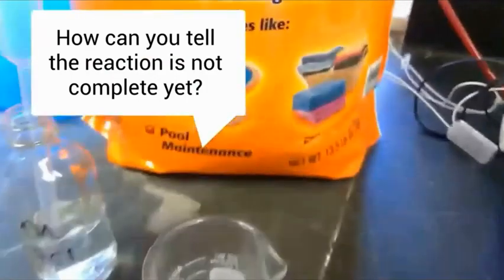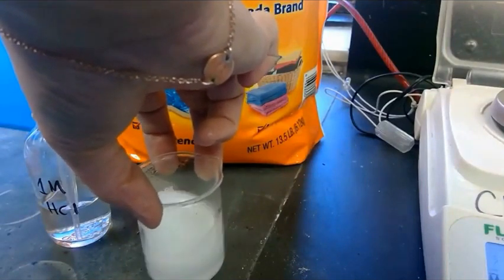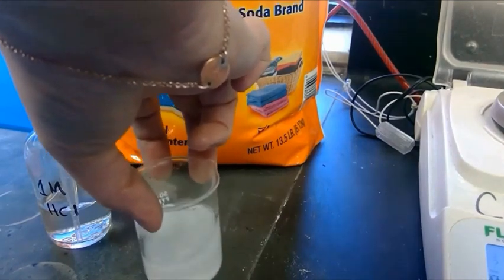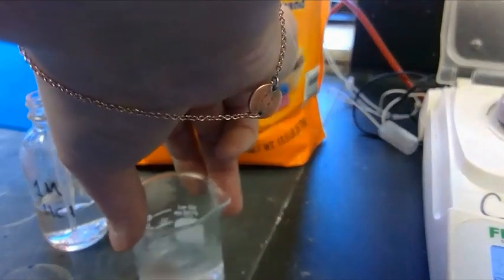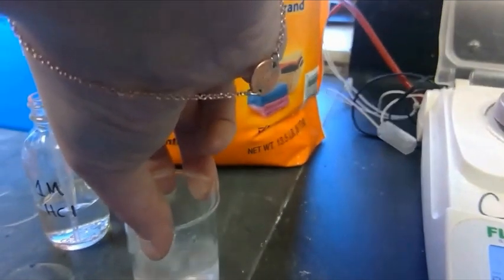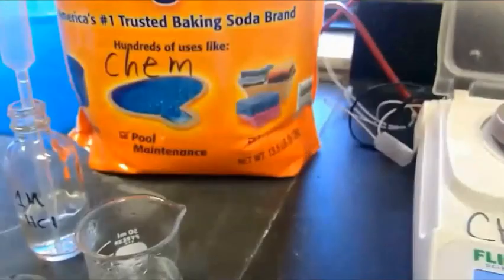We see clear evidence that there's still baking soda, that large white circle in the bottom of the beaker, so our reaction is definitely not complete yet. Getting closer though, there's very little baking soda left. I can just see a little bit of bubbling right in the center in that tiny little white dot. Just a small amount remaining.